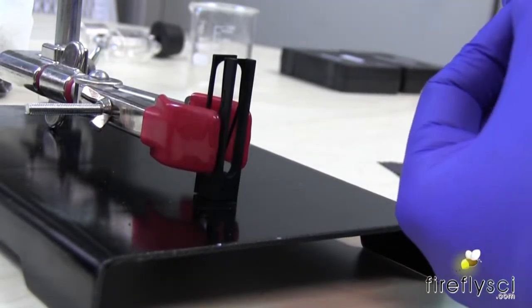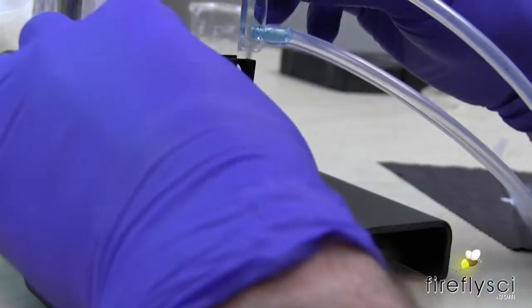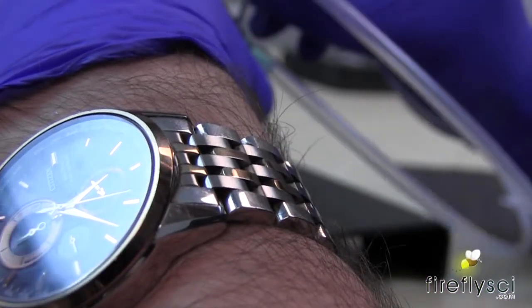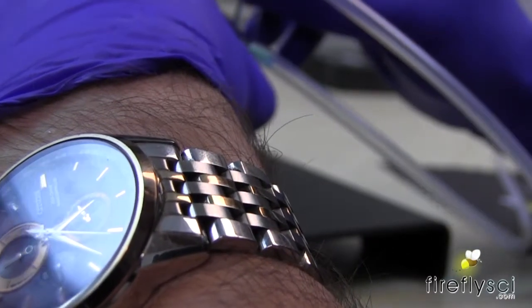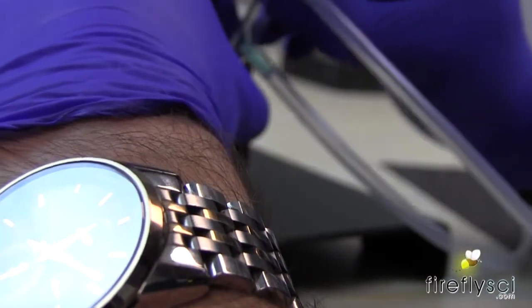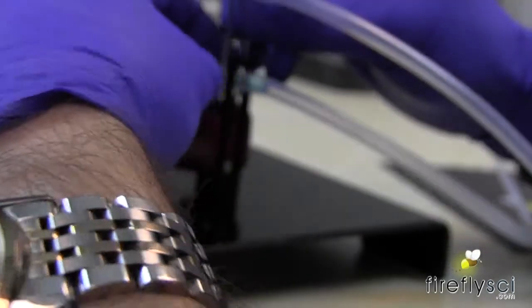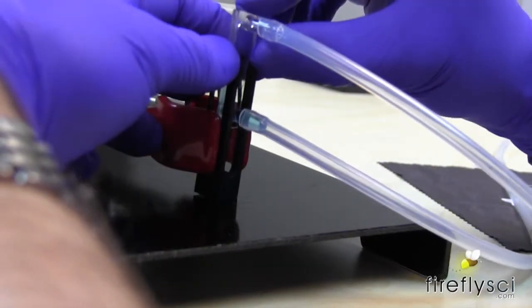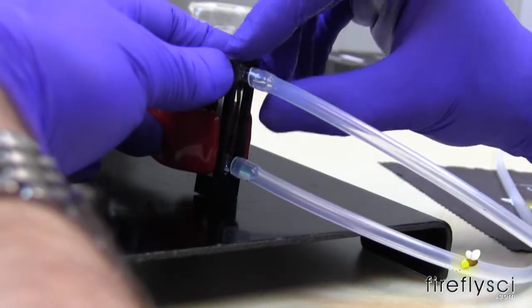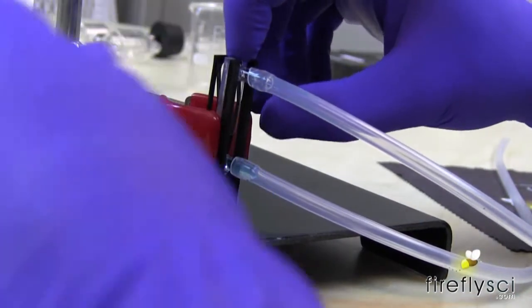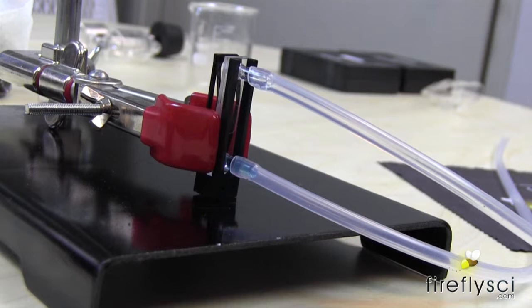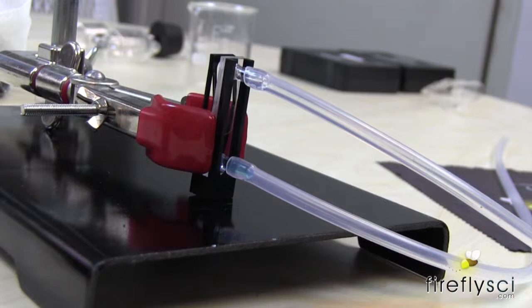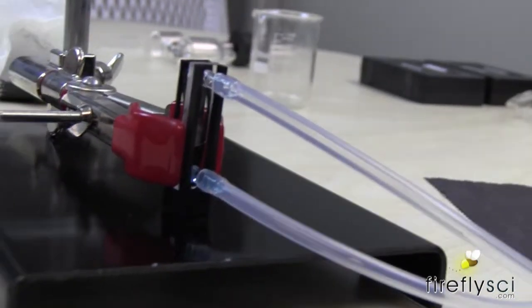Okay. And now I'm going to put the cuvette into the cell mount here. It's important that you keep the two plates together when you slide this down. All right. There we go. I'm going to try to get a good angle so you can see the flow here.